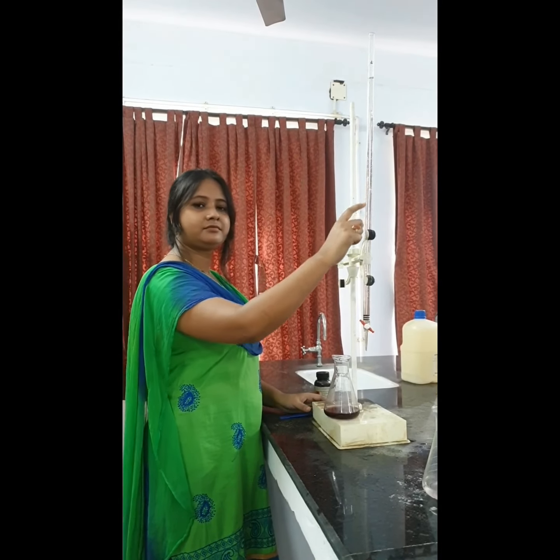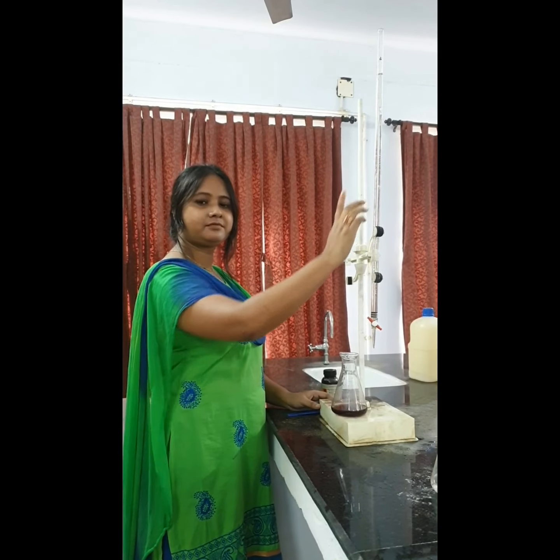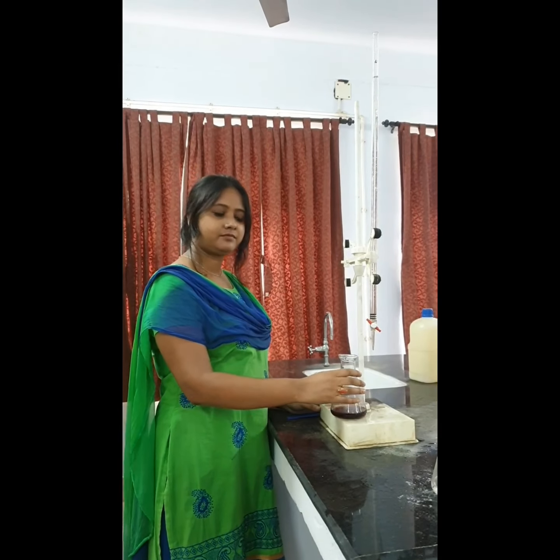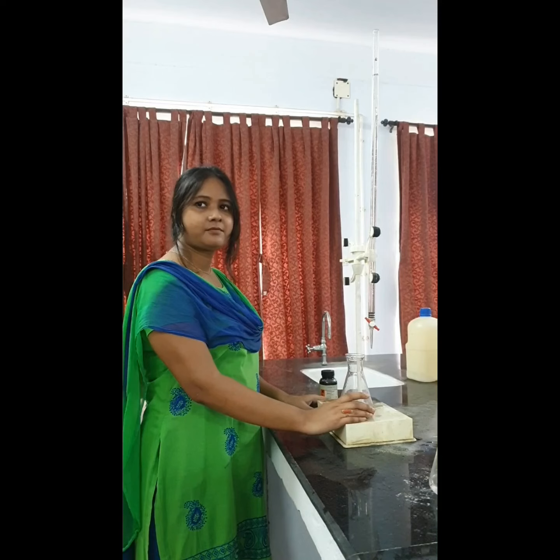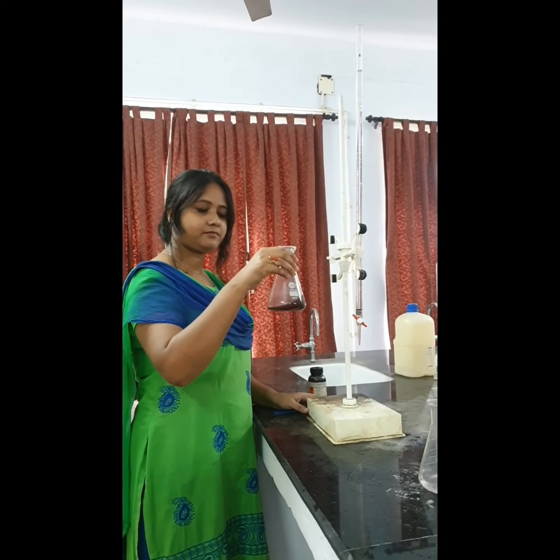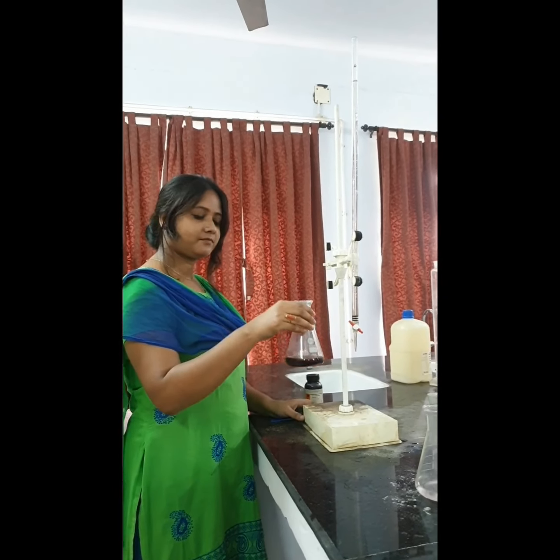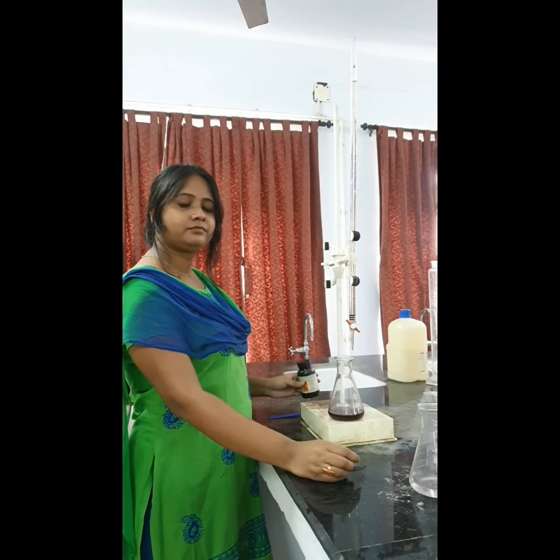Okay, dear students, now the titrant, that is the EDTA, has been taken into the burette. Ma'am is showing that the EDTA solution is inside the burette. Then the sample has been taken. Sample means a normal sample of water, that can be tap water or any water that has to be estimated for hardness. That has been put into the flask which is in ma'am's hand, and the indicator Eriochrome Black T has been added into it, so that wine red color has been developed. Similarly, we will do it for you.